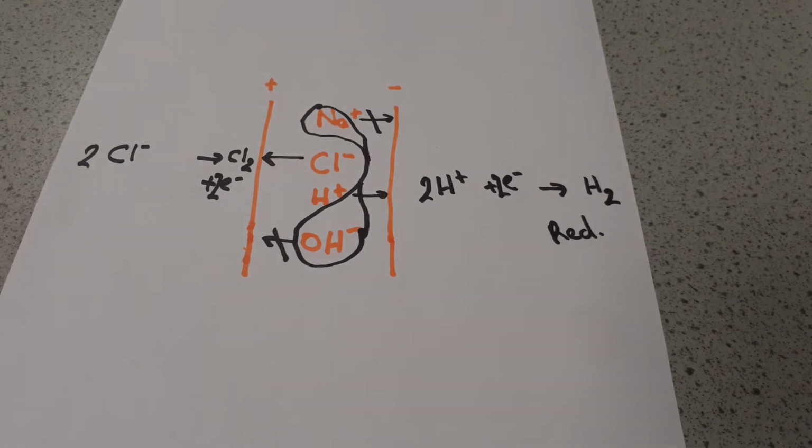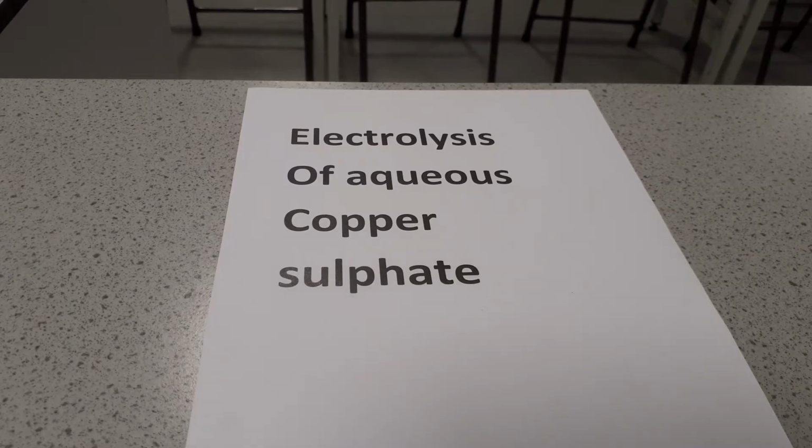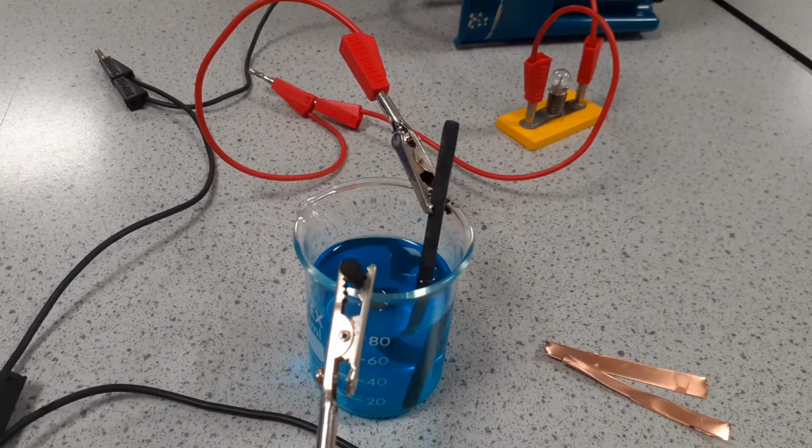That's why it's alkaline. Now the second part of my video is electrolysis of copper sulfate. I'm going to do this with both carbon and with copper electrodes, and we'll see if there's any difference between them. The first one I'm doing is aqueous copper sulfate with carbon electrodes.